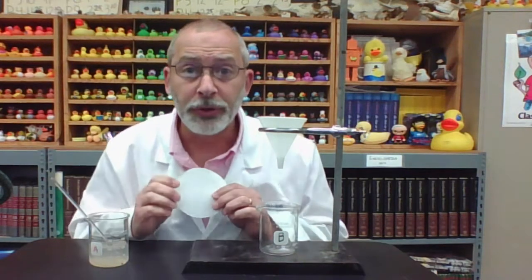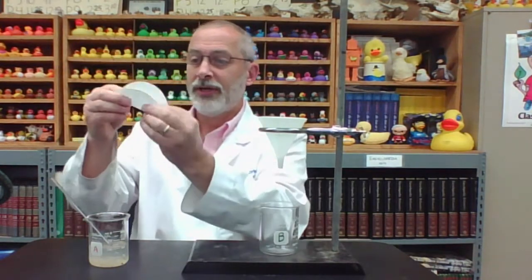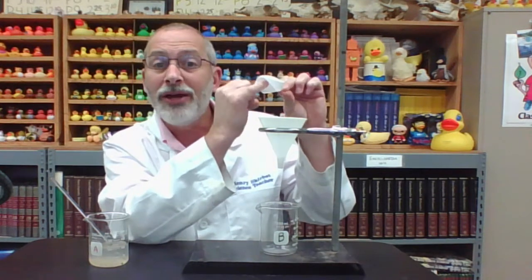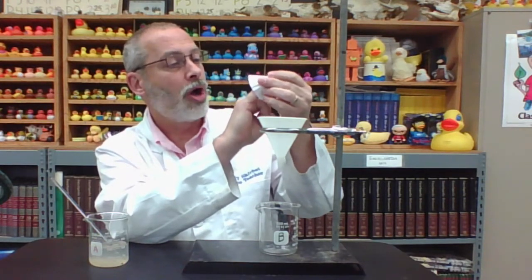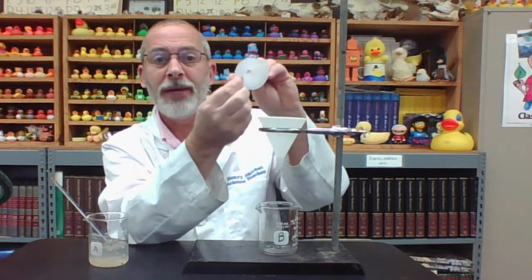I am going to fold the filter paper as per the instructions from the Lab Techniques video, starting with a full moon, folding it into a half moon with a crack down the middle. You take the half moon and fold it again to get a quarter piece, like a quarter of a pizza pie. Take your pinky finger and stick it in the crack so that one layer is beneath and 3 layers are above. Pinch the point of the cone, and you will have formed a cone-shaped filter paper that is not open on the bottom, but closed on the bottom to make it an effective filter.